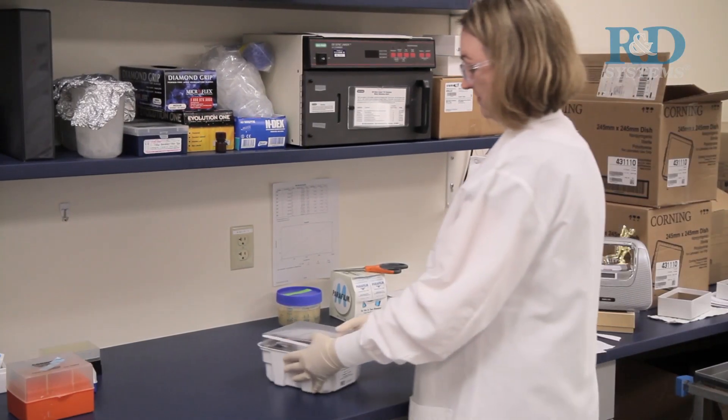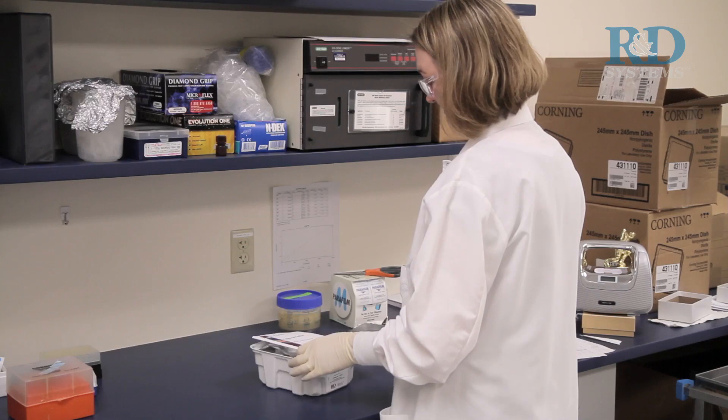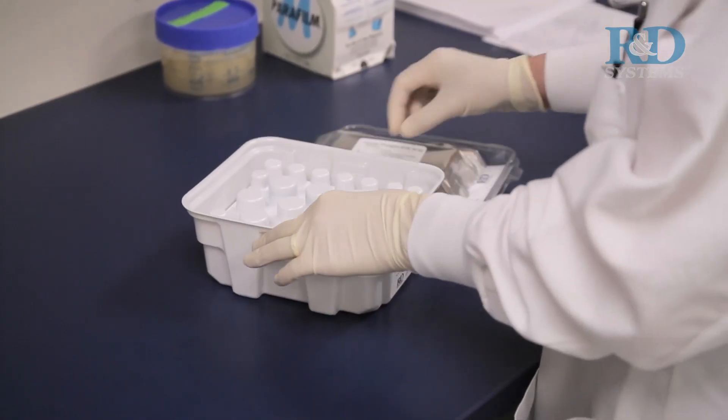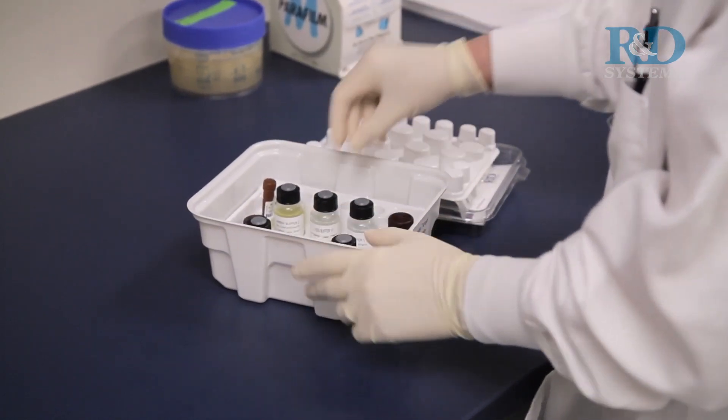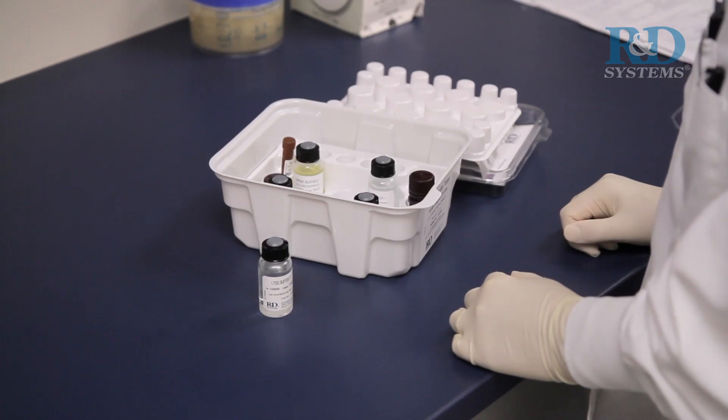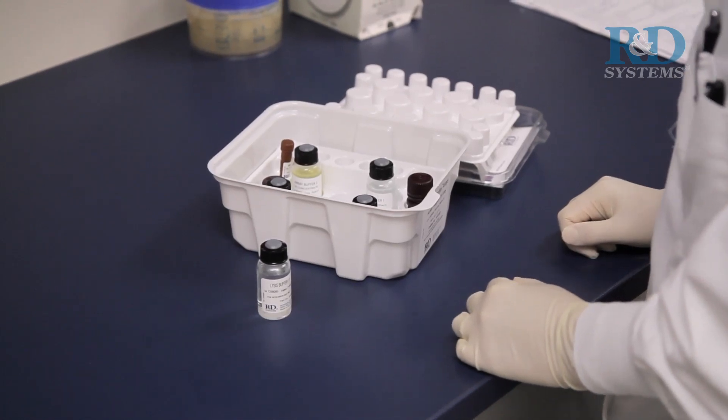To begin sample preparation, remove the lysis buffer and array buffer from the R&D Systems Human Phospho RTK array kit. The lysis buffer has been optimized for this kit and substitution of other lysis buffers may affect the final performance of the array.